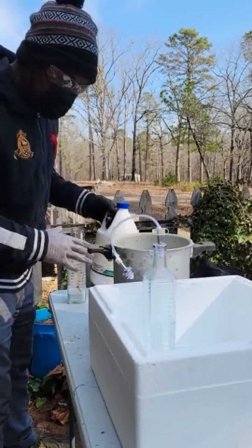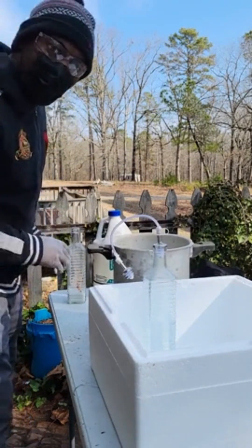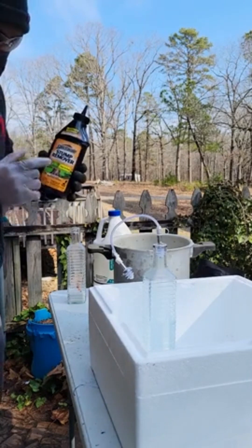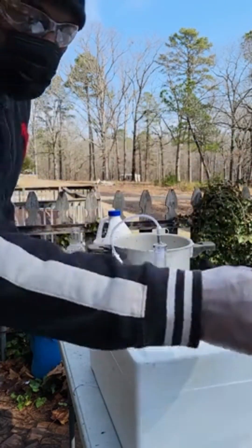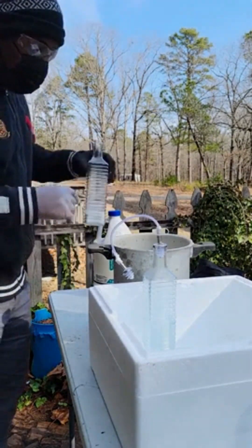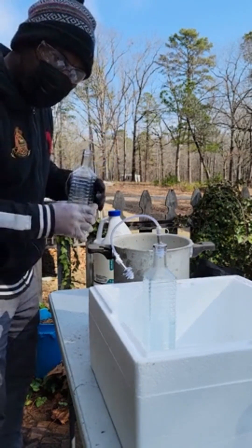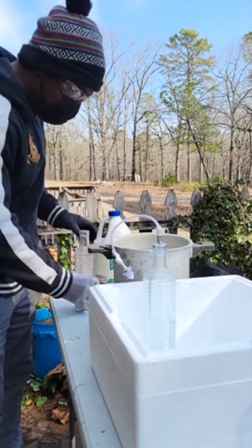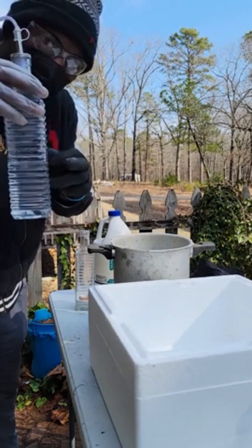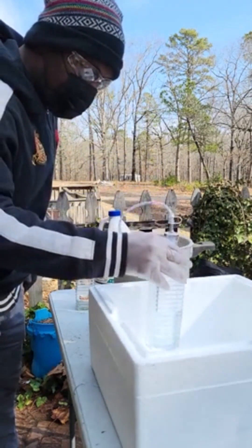I'm going to use some hydrochloric acid and some potassium nitrate to get the nitrate out of there, and we're going to use some copper in there as well to help the reaction. Those gases are going to go into this hydrogen peroxide that's cold.